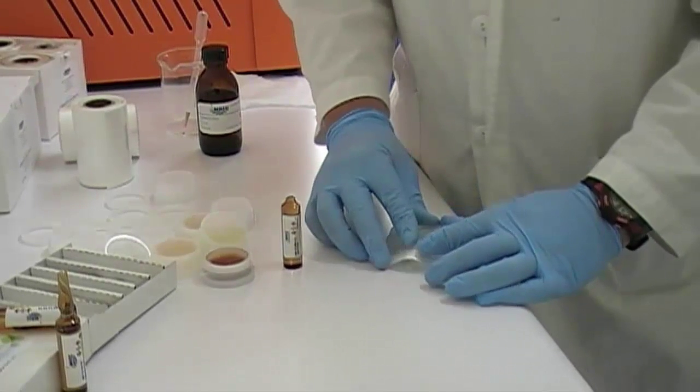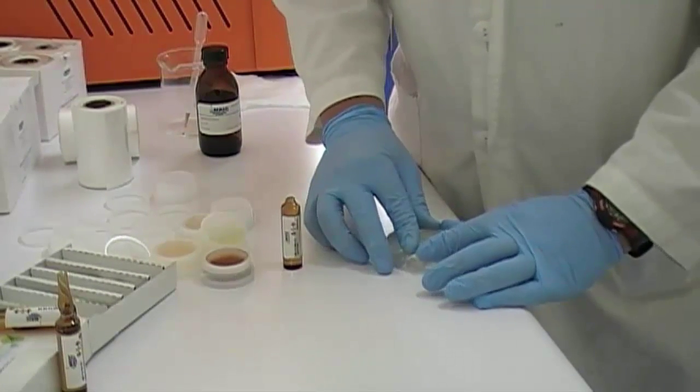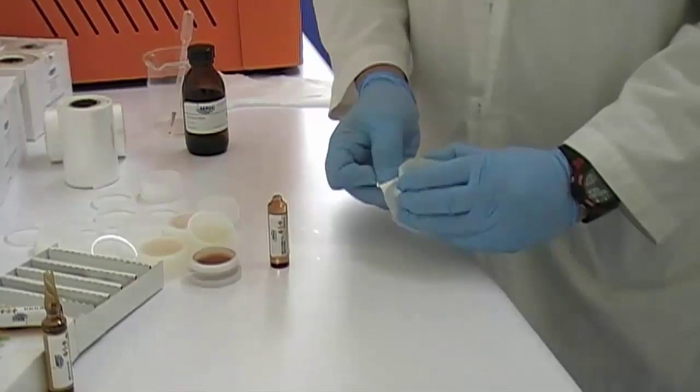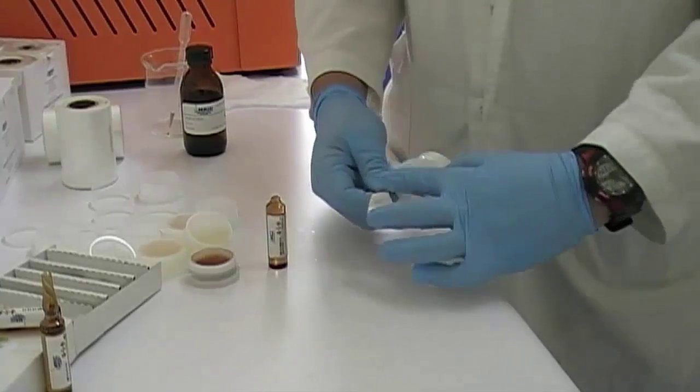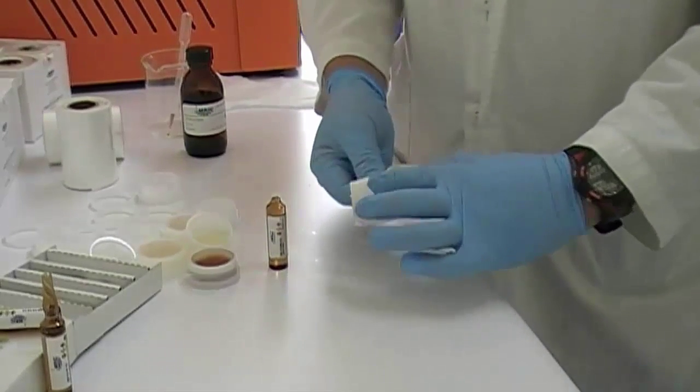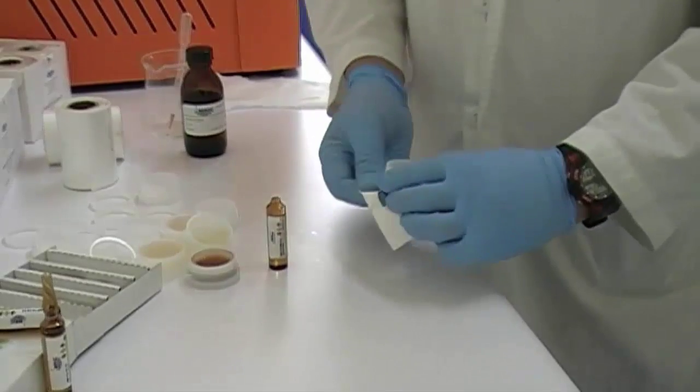Fifth, use the outer ring to secure the film to the cell. Sixth, already done this, you can cut the white part of the film for proper use on the equipment.